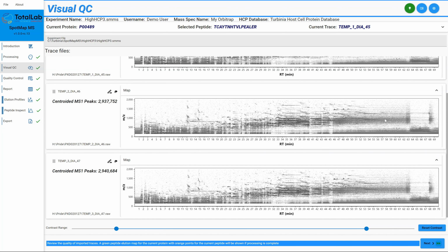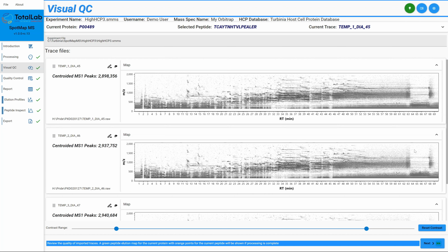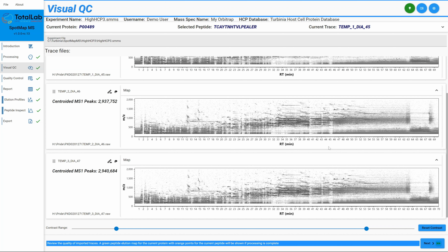But it's also within these that you would be able to spot any immediate errors in your sample, in the way that the machine has dealt with your sample. That'll make sense in a second when I show you a classic example of it going wrong and what the outcomes of that were. As you can see here, all of these samples pretty much line up with each other. Again, it's the same sample run 3 times, so that's what you would expect. This is the first QC metric that users have got to go off within the software to make the decision as to whether they want to analyze this data set or not.